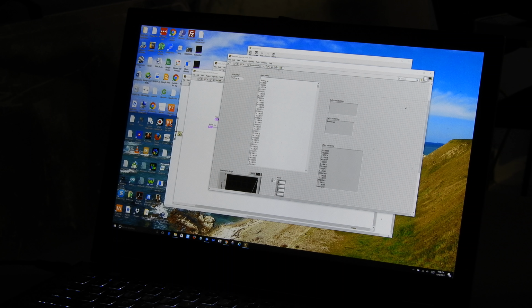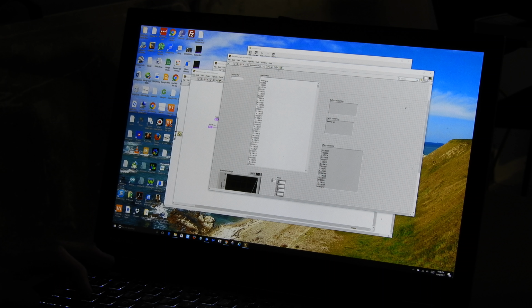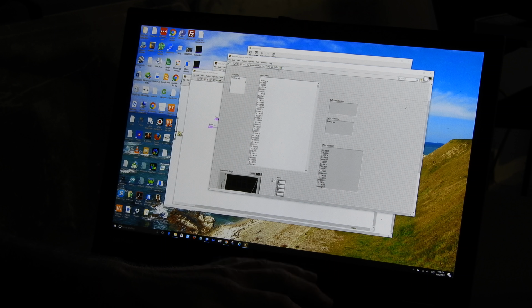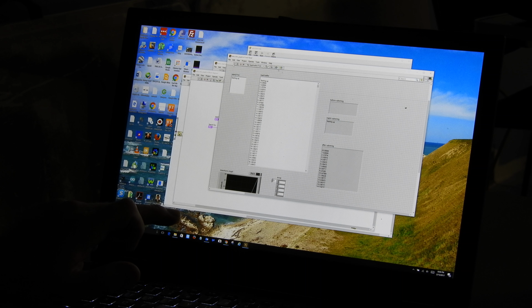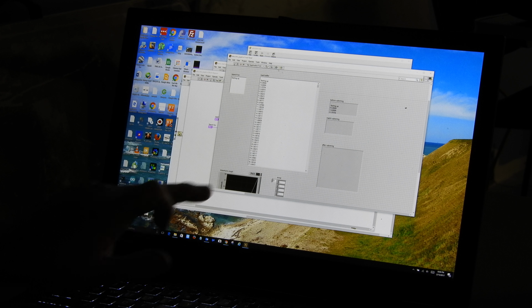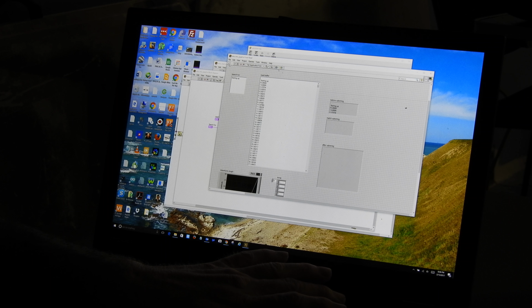One thing I don't like about it, though, is it seems to have a carriage return. So I'm going to go ahead and take this, and I'm going to add a carriage return to it. Ooh, let's Control Z that. Okay, let me make this bigger first of all so I can see what's happening. I'm going to add a carriage return. And now I'm going to say, Edit, make current values default. And now I'm going to save that change into the front panel. Now we're going to search. Does it find it? No, it did not find it. It really didn't like that. So we're going to go back and take it off. Edit, make current values default.